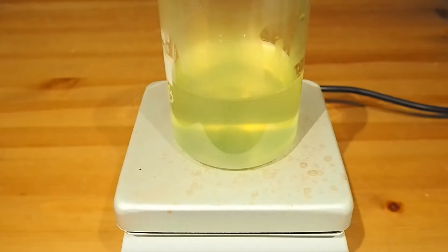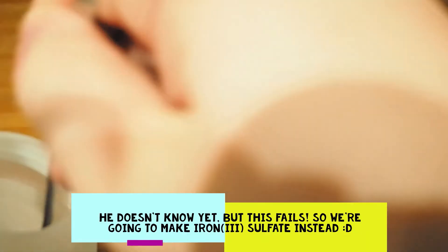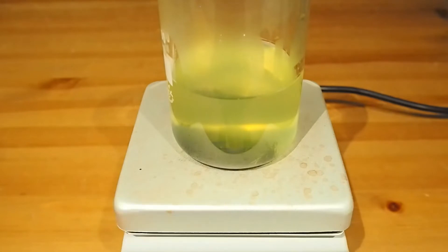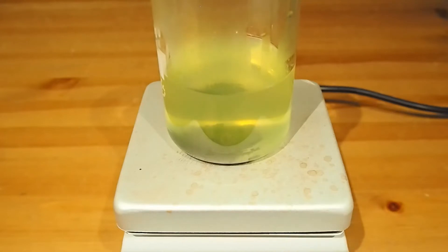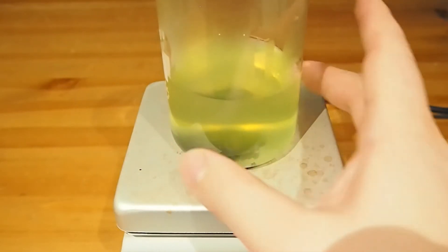Well here's our filtered solution, it's still a little bit murky, which I'm not happy about at all. But this is where a bit of the science comes in — I'm going to put a little bit of iron in with this. So we're going to reduce the volume, and I'm a bit concerned that when I heat it, we'll get Fe2+, which is this lovely green solution, go to Fe3+, and I don't want that at all. So I want to see if we can get this iron to mix — it's sort of mixing but it's definitely not stirring. But the important thing is that it's moving around a little bit. And then what we're going to do is start to reduce the volume by heating this a little bit — we'll take some of this off, well, steam, because it's just water.